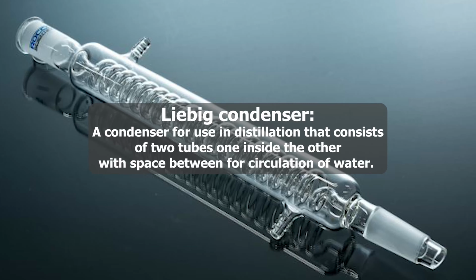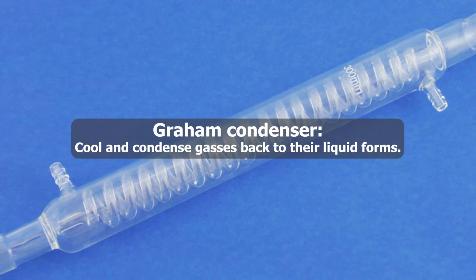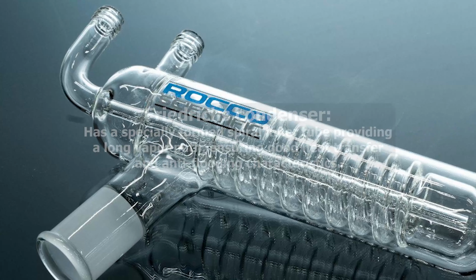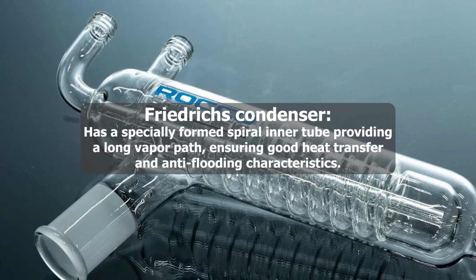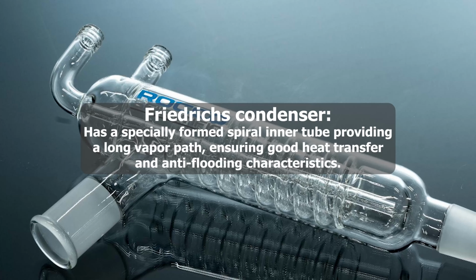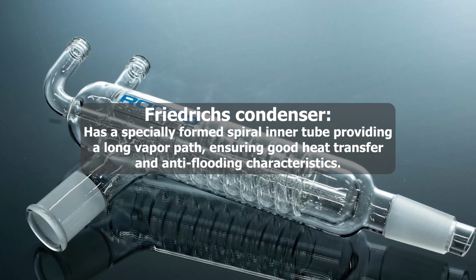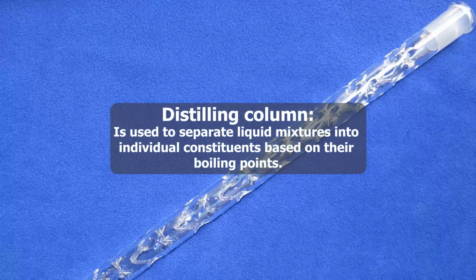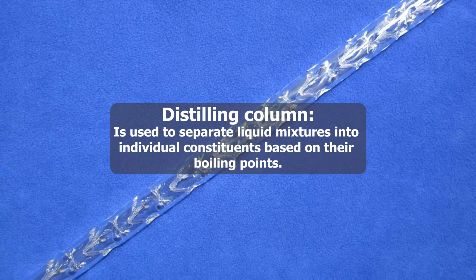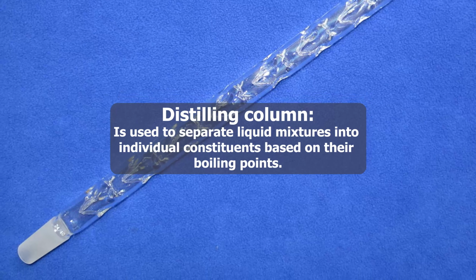for circulation of water. Graham condenser: cools and condenses gases back to their liquid forms. Friedrichs condenser has a specially formed spiral inner tube providing a long vapor path, ensuring good heat transfer and anti-flooding characteristics. Distilling column is used to separate liquid mixtures into individual constituents based on their boiling points.